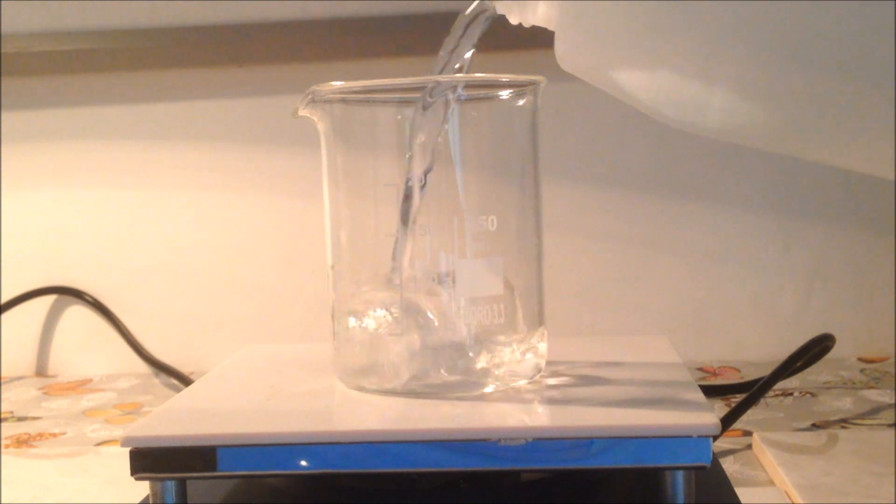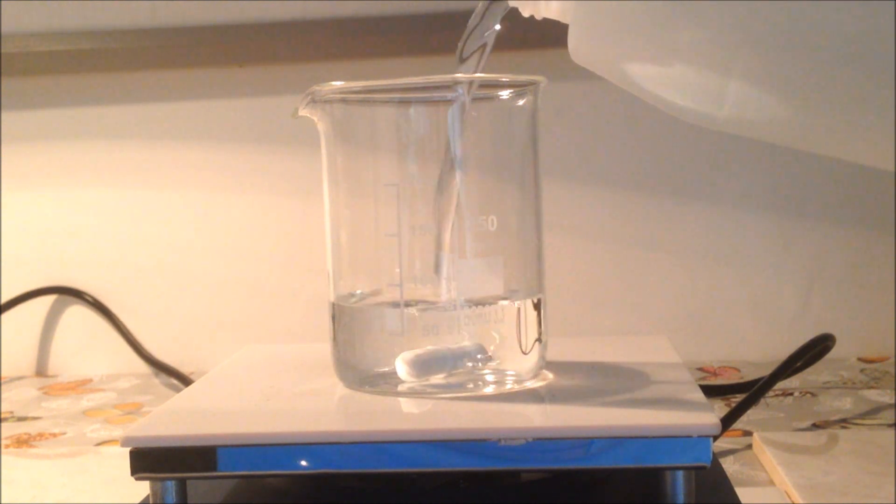Hello, this is Samuel from 18th Time Lucky, and I'll be showing you my synthesis of sodium citrate.